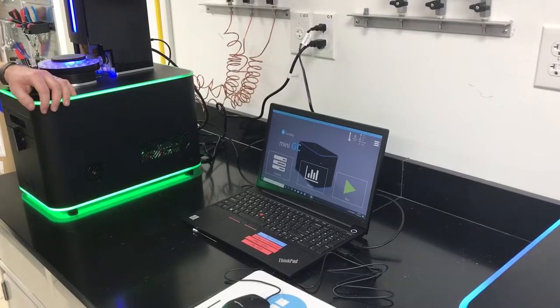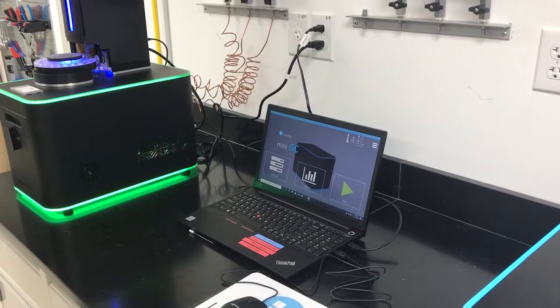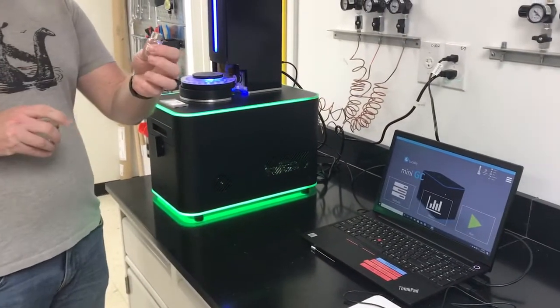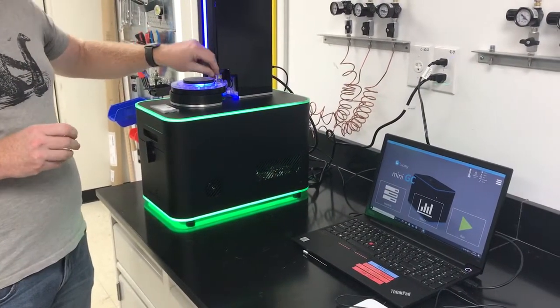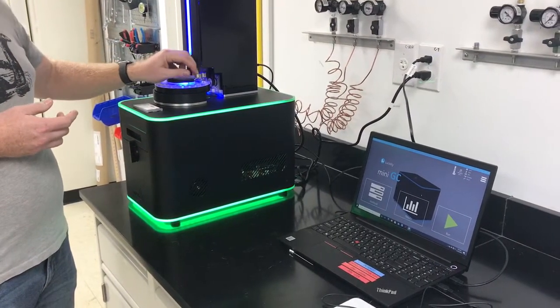Now that we have our auto sampler aligned, it's time to start a run. So in your accessory kit, you'll have several vials. We have one for waste. We're going to put that in the W. We're going to have one for solvent. We use IPA. We're going to put that in the S.